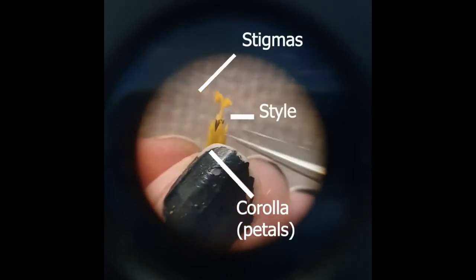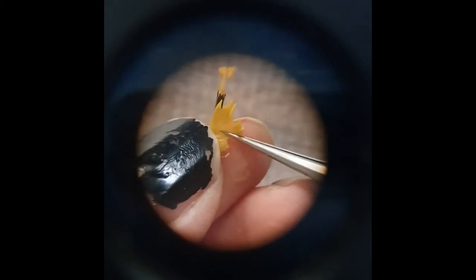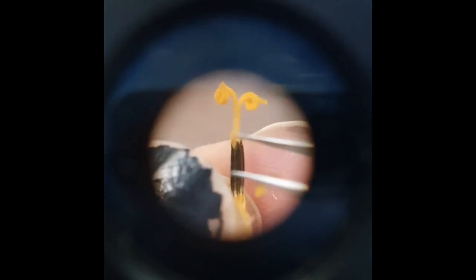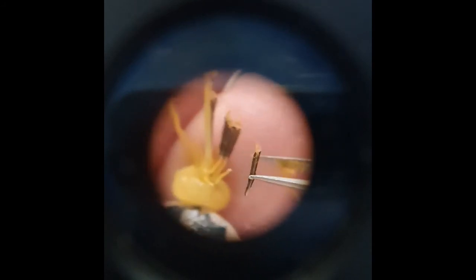Meanwhile, in the disc florets, you can actually see all the parts of your typical flower. These parts are quite reduced, but they are there — stigmas, style, and the corolla, which I'm removing now. The corolla is composed of all the petals in the flower. Once they're peeled away, you can see the stamens, which are really darkly pigmented, held inside. You can separate the stamens away from the pistil to expose the rest of the style. The style leads down to the flower's ovary, in which the seed will develop after fertilization.